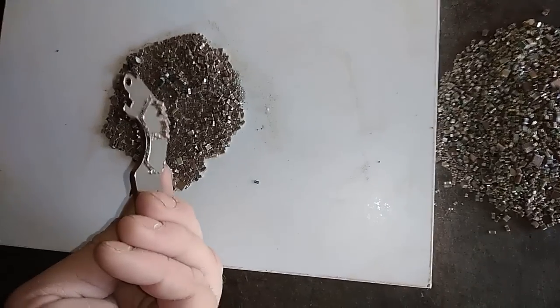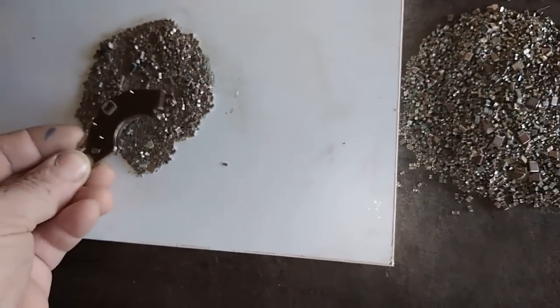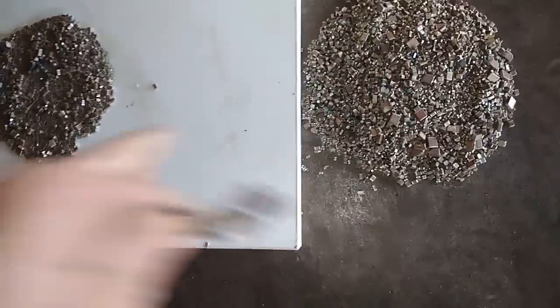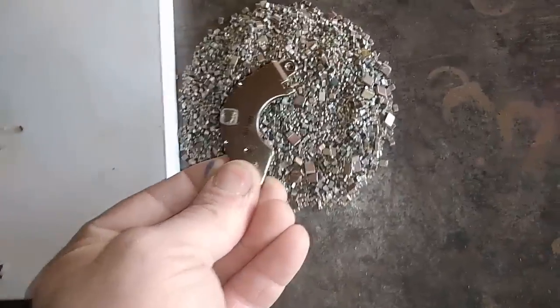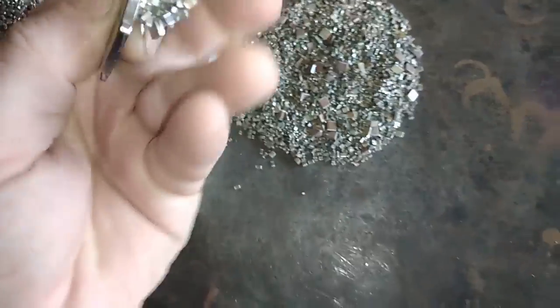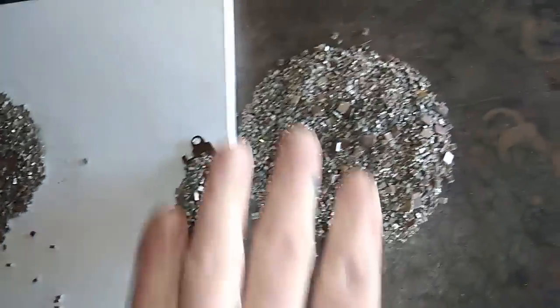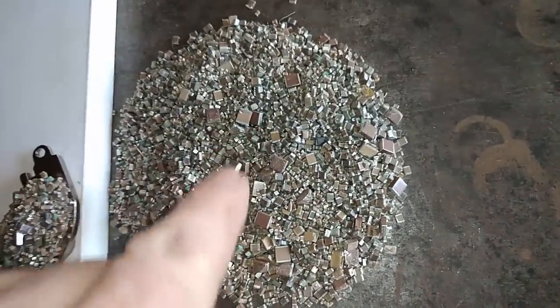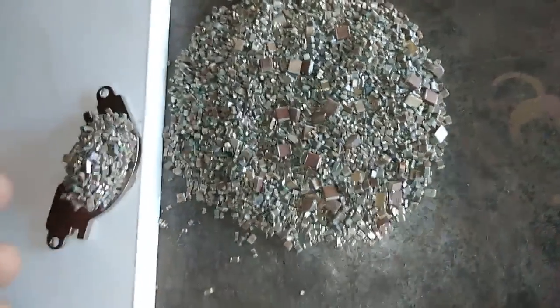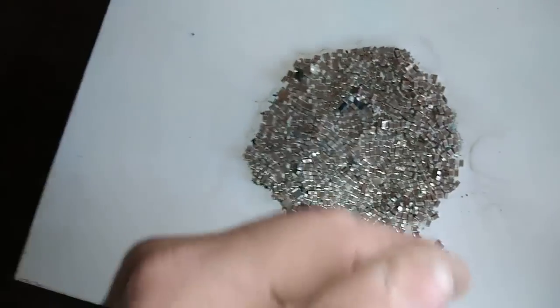See that? Just a couple are slightly magnetic, but mostly not magnetic. On this bigger pile it's magnetic - very, very magnetic. So probably this contains some silver, and mostly it's nickel. It's a shame because I have some pretty big MLCCs there, but unfortunately they're magnetic. This little pile here is actually non-magnetic, so I will do that separately.